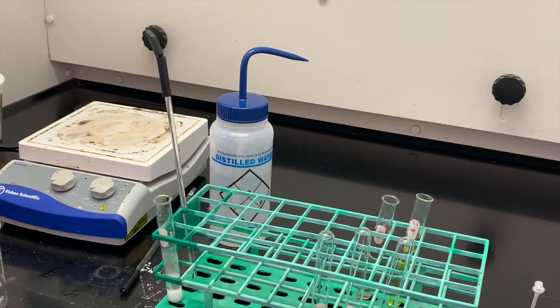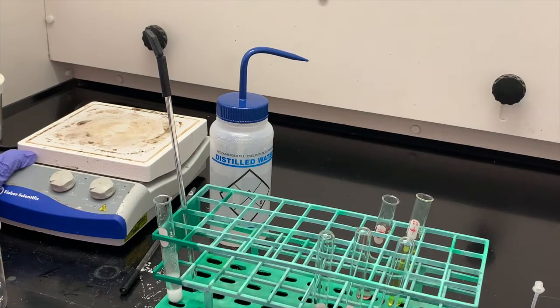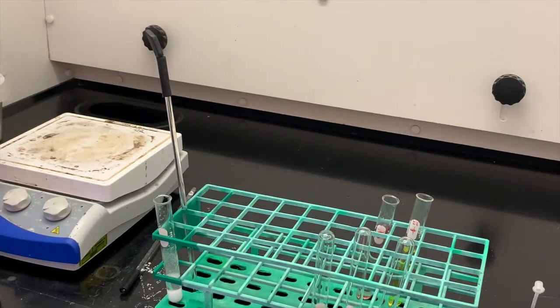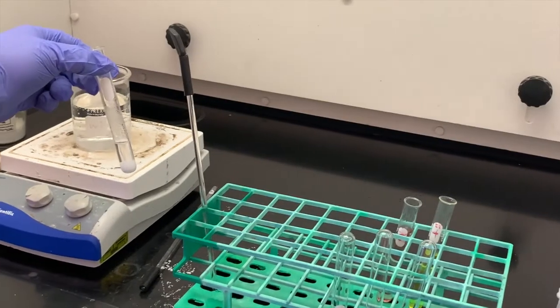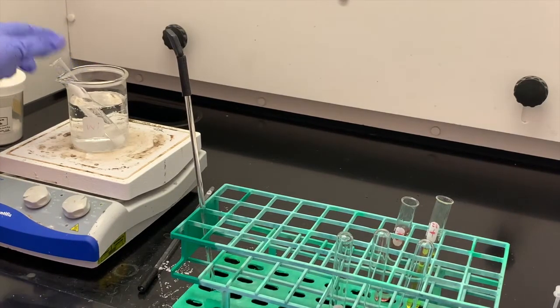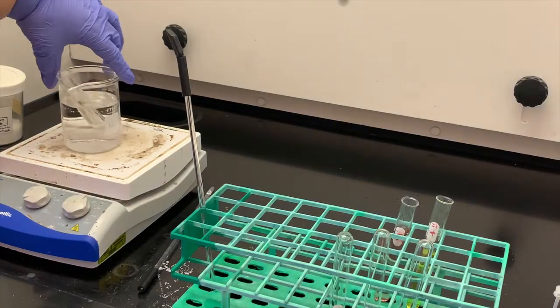Now we're going to take that same test tube and put it into a hot water bath. So I need to make that hot water bath and see what happens when we heat up this test tube. I am putting this test tube into my hot water bath, just going to set it in there and let it heat up, and we'll come back and look at it once that hot water has heated up.